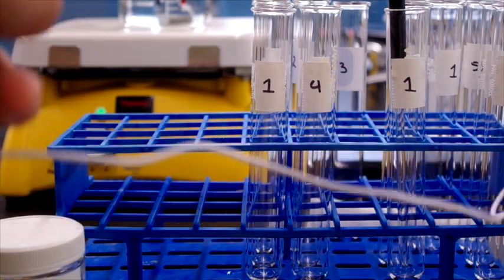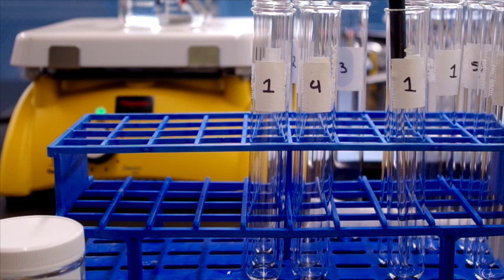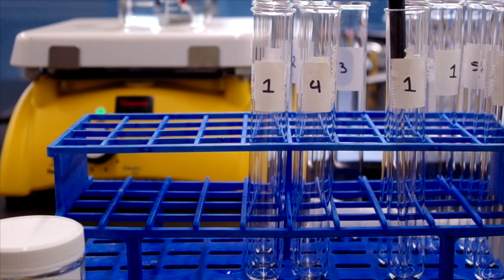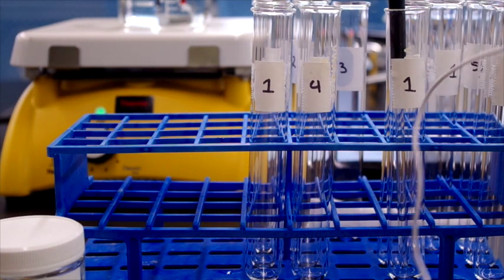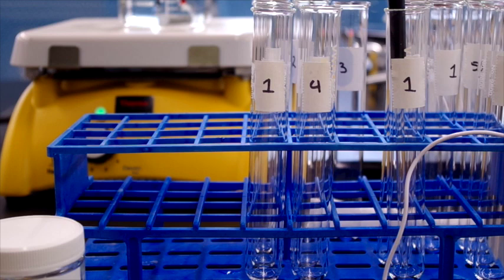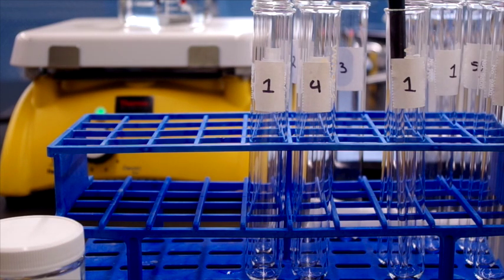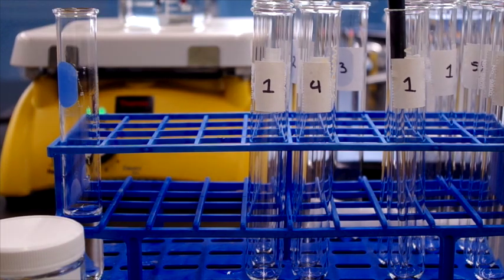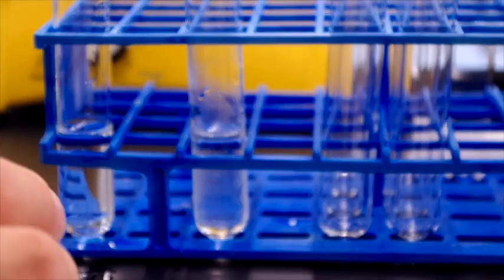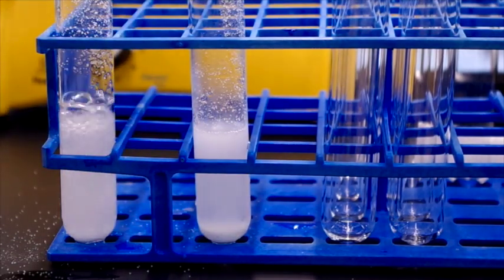I'm going to test the temperature of each solution with this digital temperature probe to make sure we're in the right place. This solution is about 43 degrees and climbing, and this solution is under 10 — 8 degrees and dropping. So we can now be certain that these two solutions are at the appropriate temperature. We immediately remove them from their baths and put one scoop of sodium bicarbonate into each one — into the cold one first and then into the hot one. Notice there's a difference.